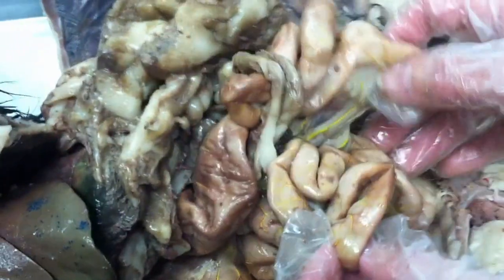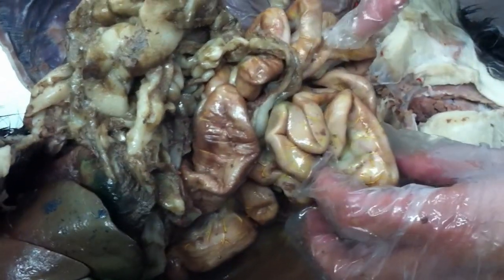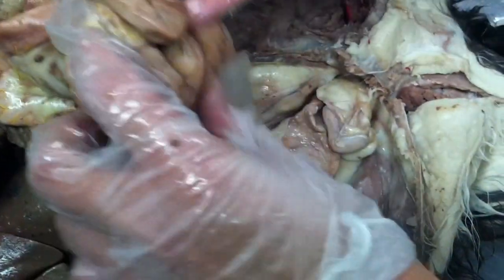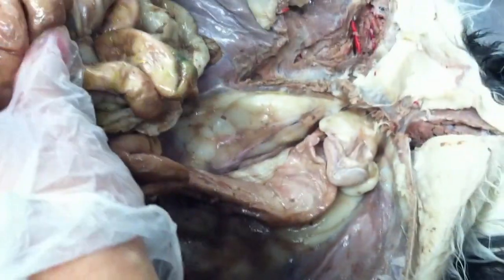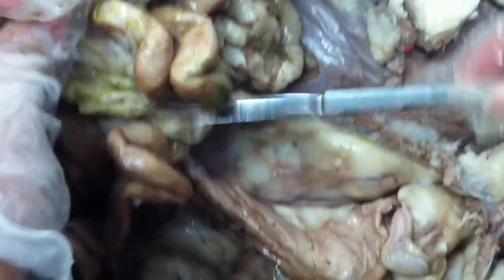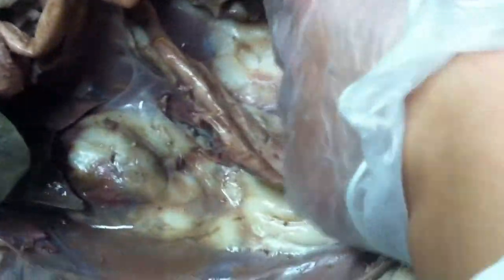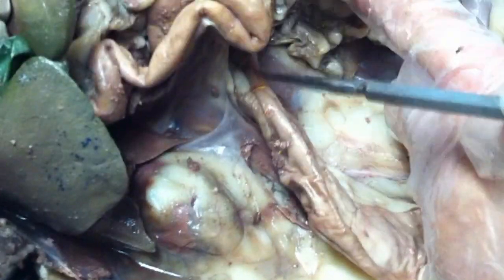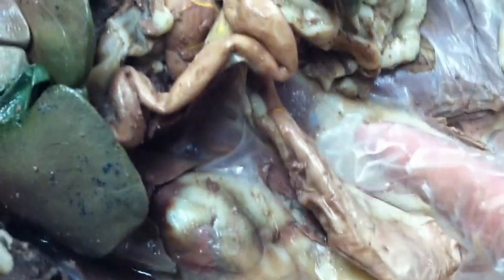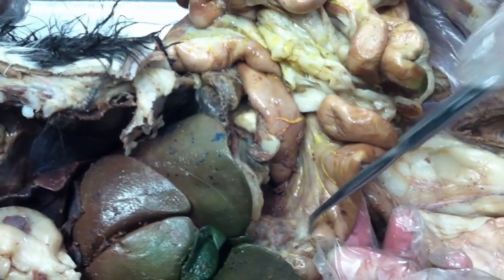It's hard to tell the junction of jejunum and ileum on this side, all right? So, where's the jejunum? That's folding. The whitish part. So the only part I can test for jejunum is here, okay? It's the starting part, when it starts to fold, right? This is folding too. So I said I'm not going to trick you. So if I test for duodenum, it should be somewhere here.